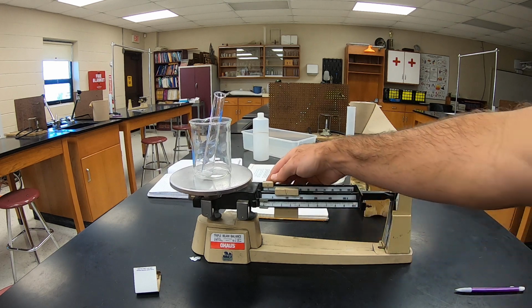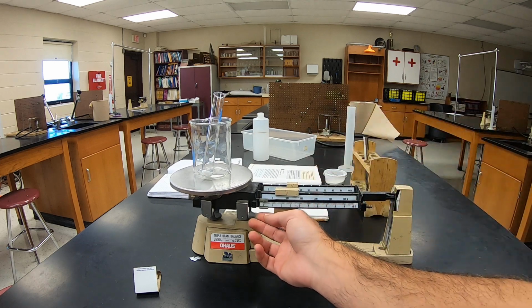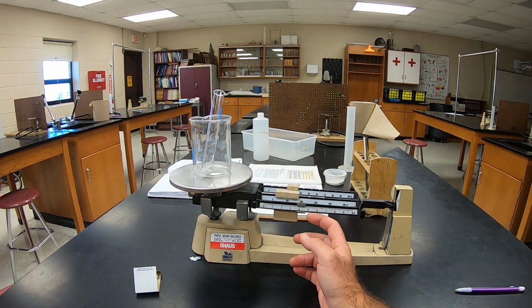So it's over 100. It's not 200 though. It's 130 something.